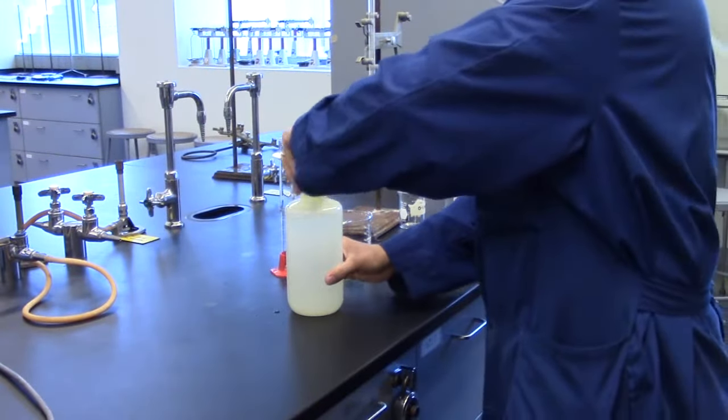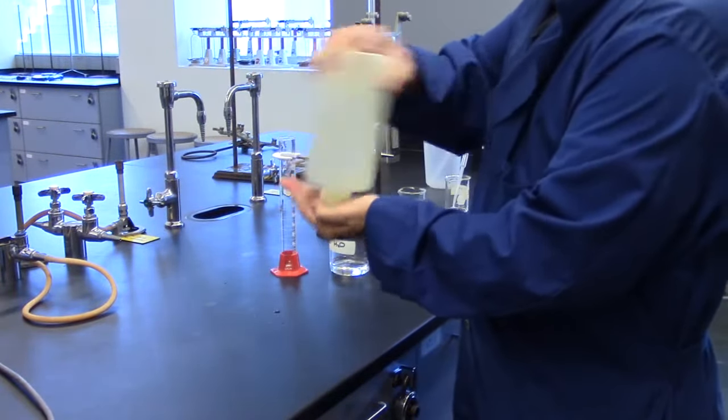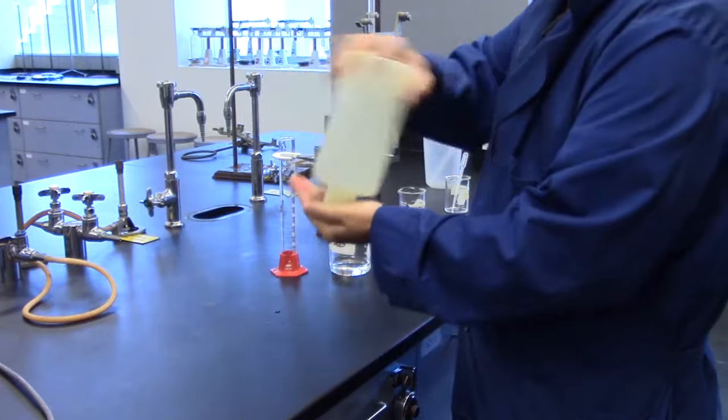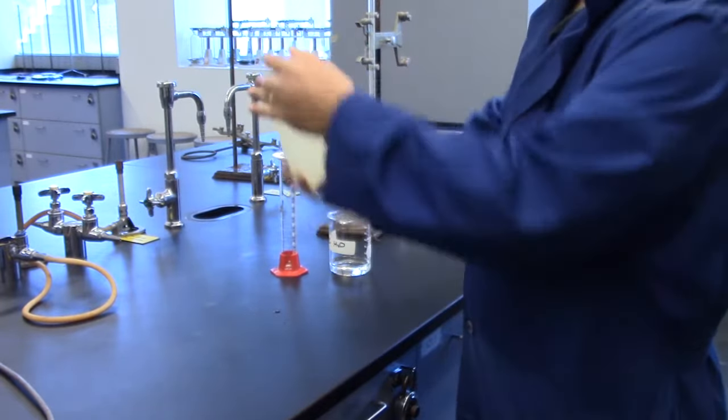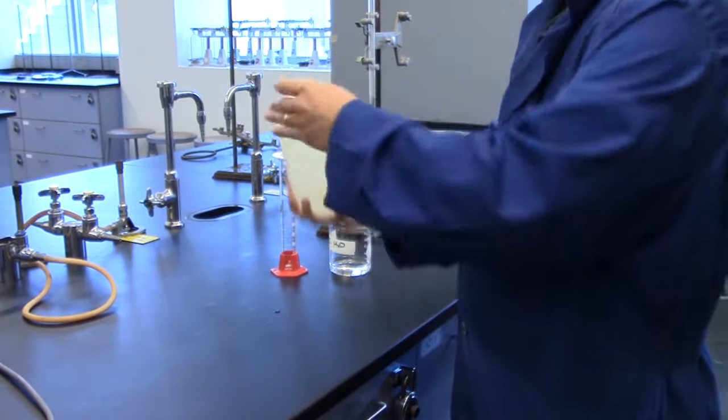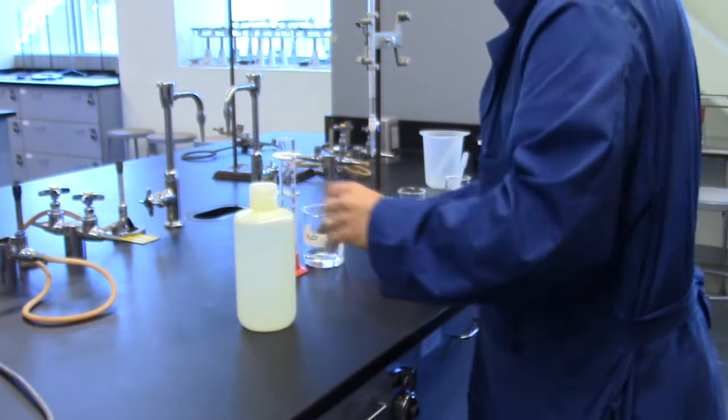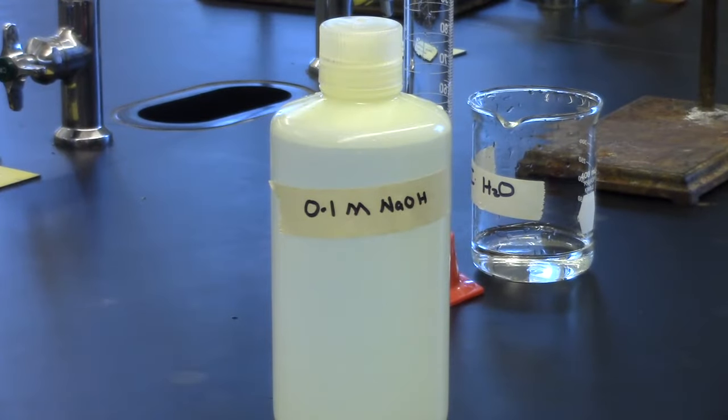Screw cap on and shake vigorously. Put a label on the bottle.